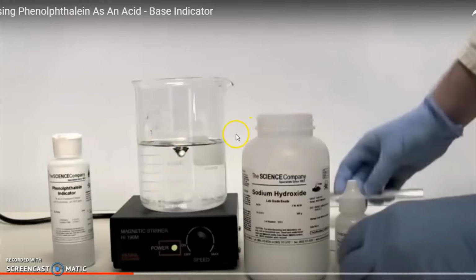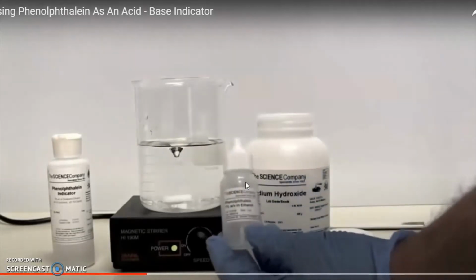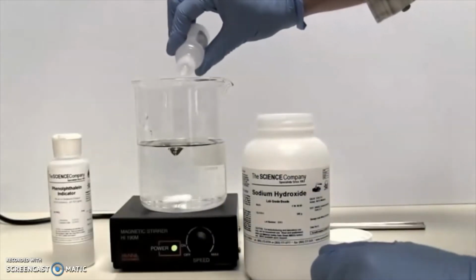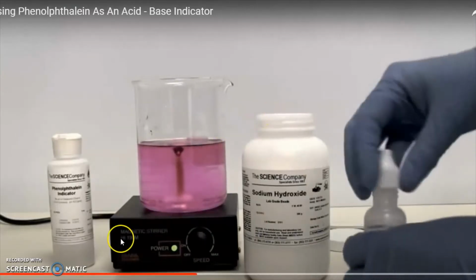So when I push play here, you're going to see this person add the phenolphthalein, and then the solution is going to turn pink because it's basic. So there's the phenolphthalein, adding it to the sodium hydroxide, and notice we get a nice pink color. So that's one indicator.